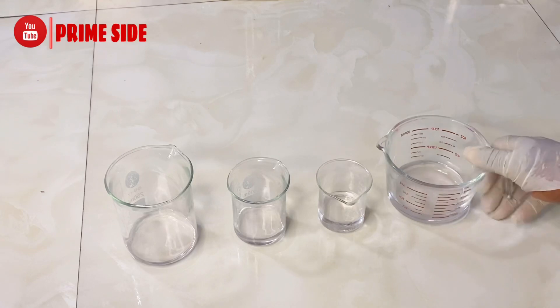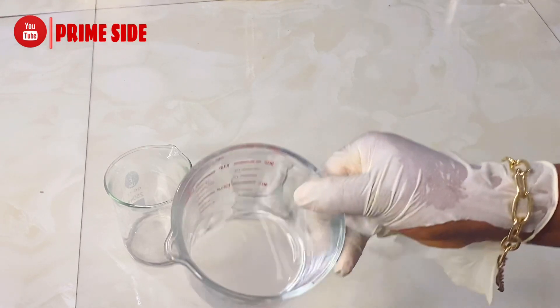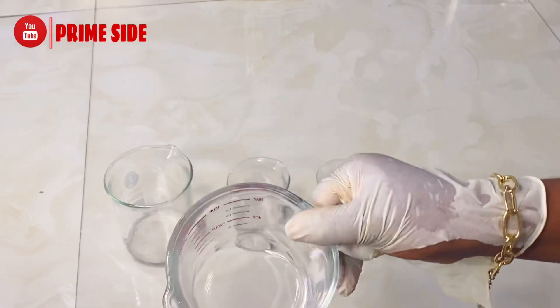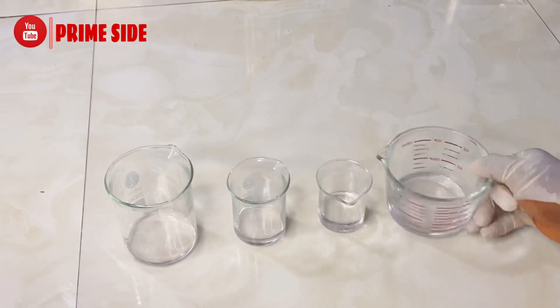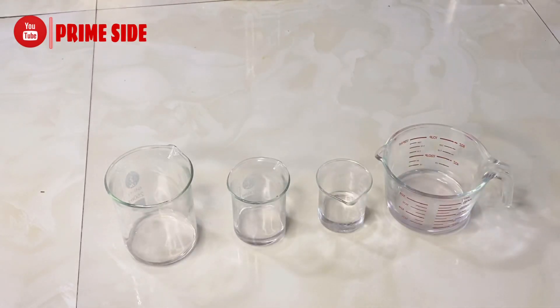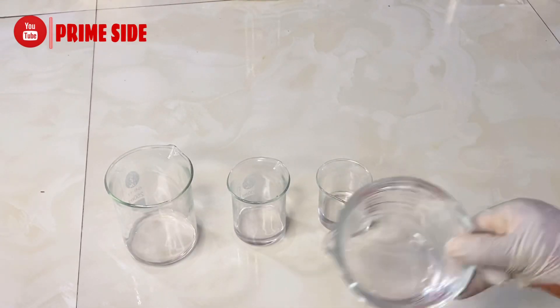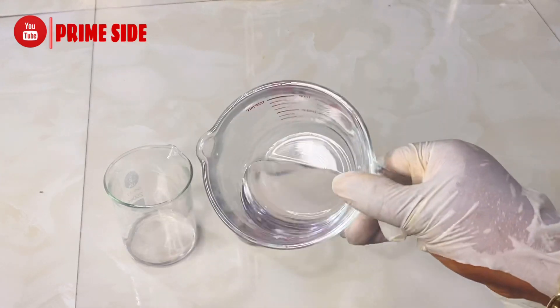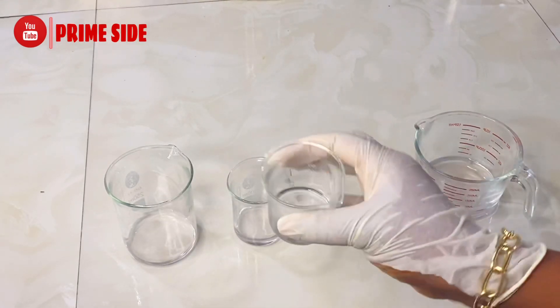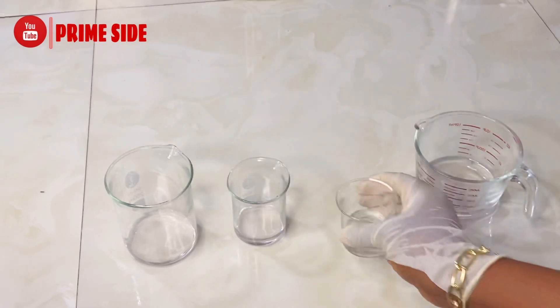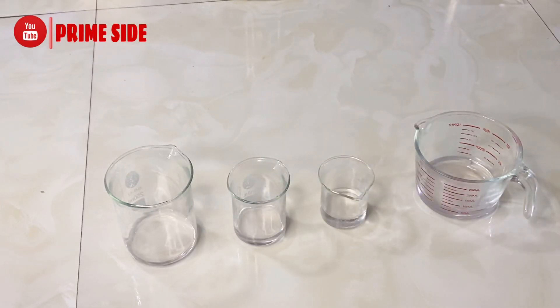Now imagine that you are using salicylic acid for commercial use and you have to dissolve all of it. It's really quicker when you use your porcelain mortar to crush your salicylic acid and then before you go in to dissolve with your propylene glycol.